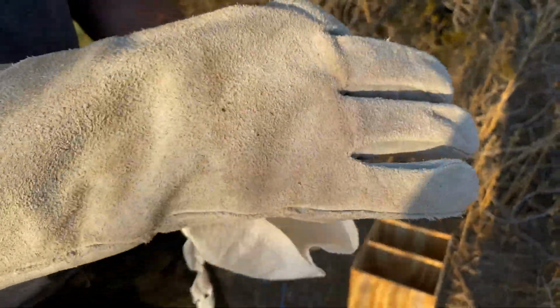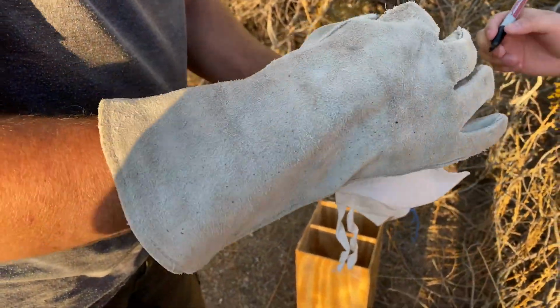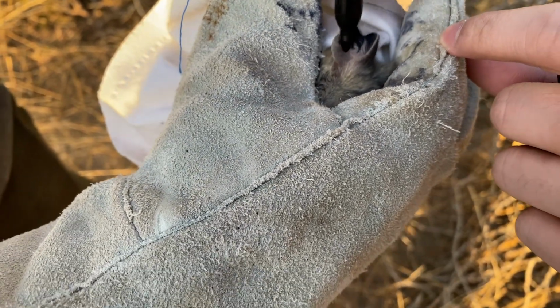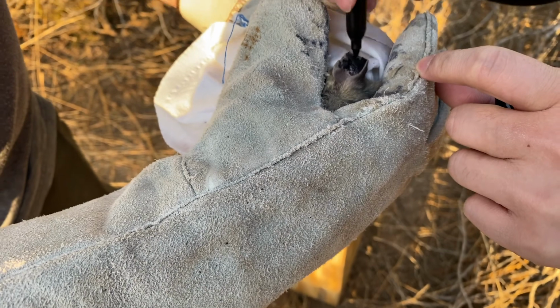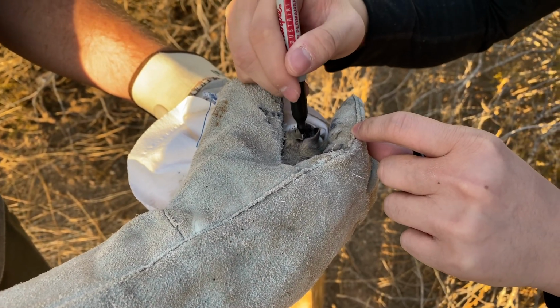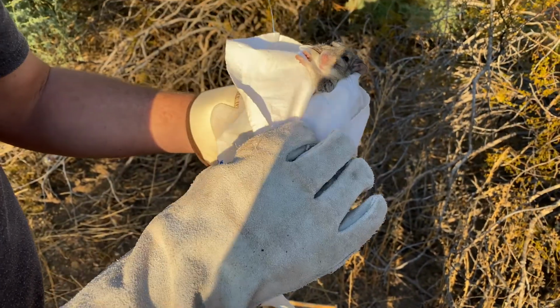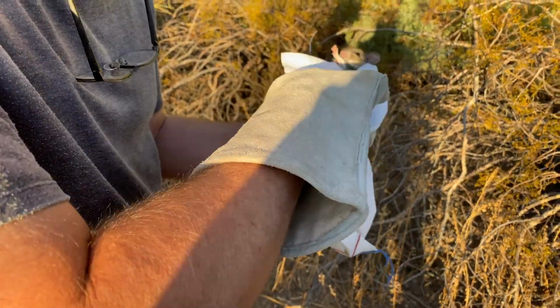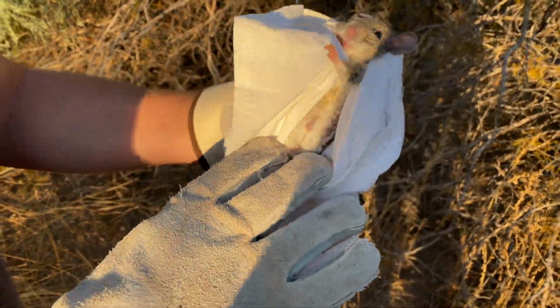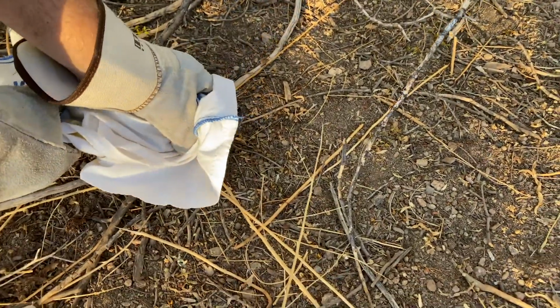All right, so they're terrified. They don't like the light. All right, so there you go, inside right here. And get sort of deep in there as well so it doesn't wear off, deep in that little fold. That's awesome. Very, very stylish, I must say, the envy of all your buddies. All right, so let's sex this, definitely a male. Okay, all right, good. So we'll release this guy. There we go, little fella.